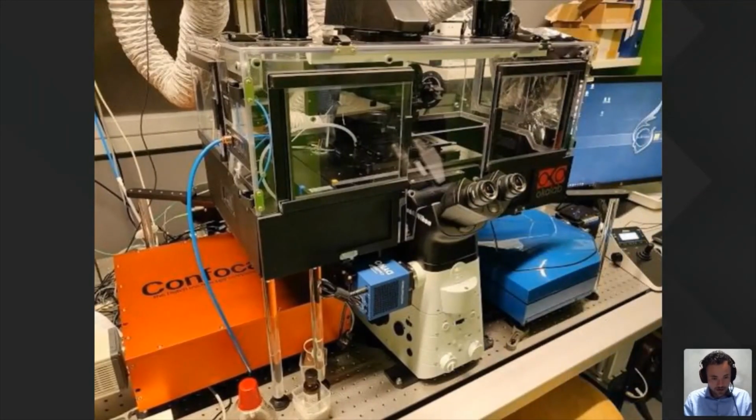Then here's a very nice system at ETH Zurich in Switzerland, where they have a Nikon TI2 with the RCM mounted to the left port. On the right port they have a 3D adaptive optics module, which is utilized for making 3D STORM images. So what they do is they correlate the STORM data coming out of the right port with the confocal data on the left. Very nice system.